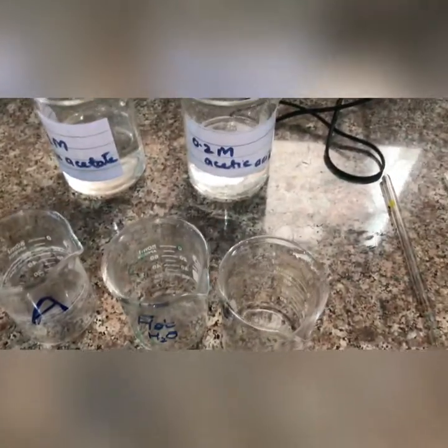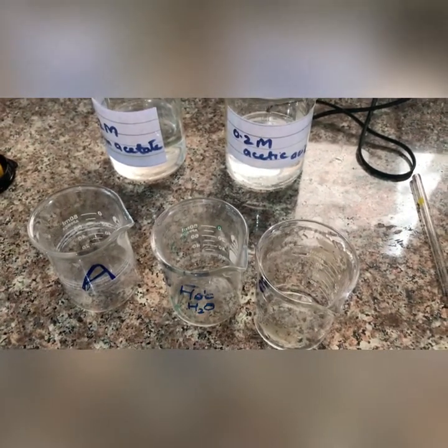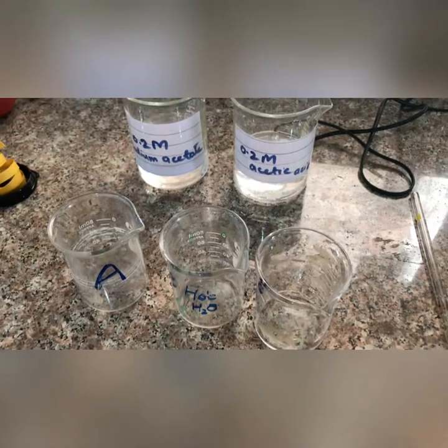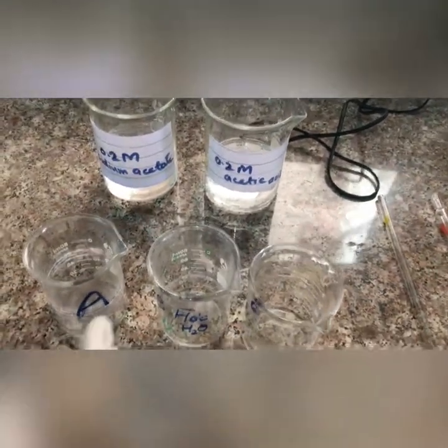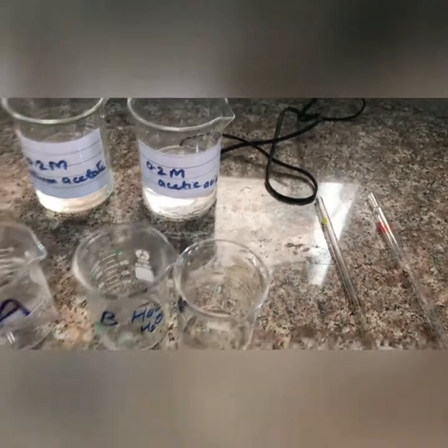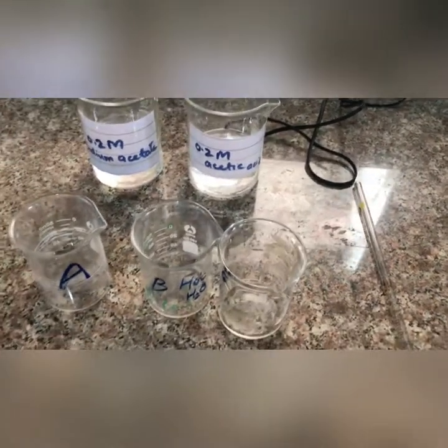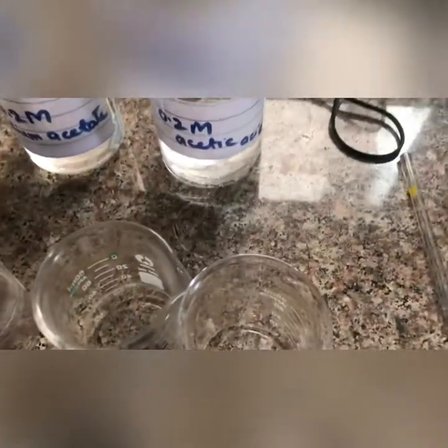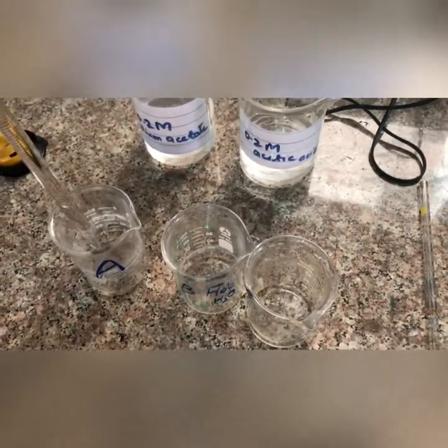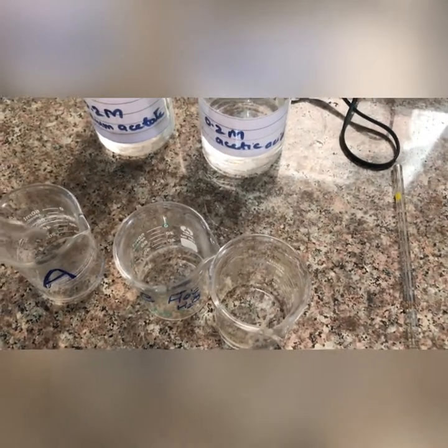First of all, we have two solutions. We also have pH paper. We have sodium acetate solution and acetic acid solution. We have three beakers: A, B, and C. We have a 10 ml solution of sodium acetate. We add sodium acetate, then add 1 ml of acetic acid to each beaker.